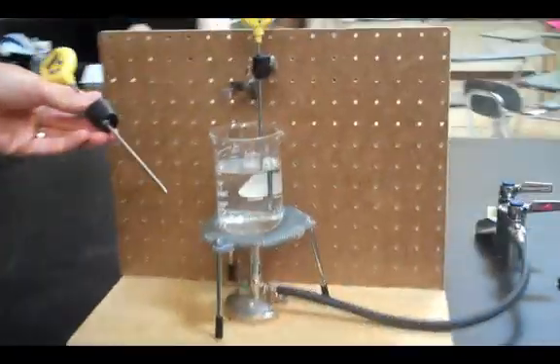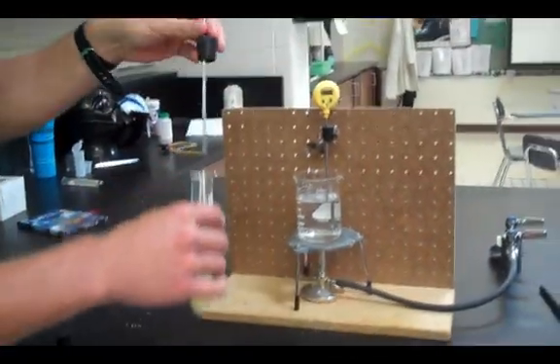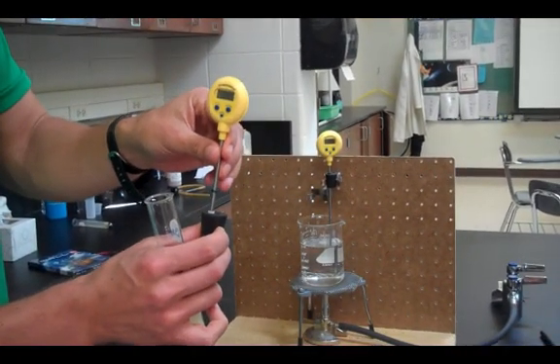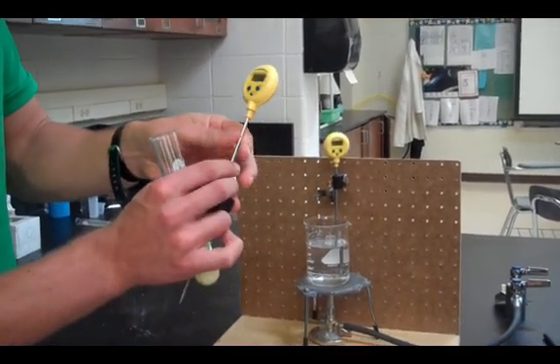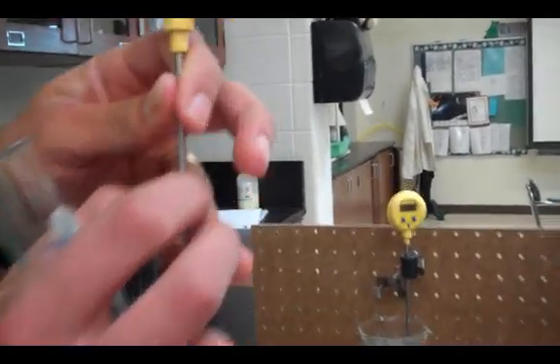So to do that, we're going to set up the experiment like this. I'm going to take my stopper that has two holes in it. One has a little white sleeve in there to hold the thermometer. I can adjust the height of the thermometer by moving this rubber ring up and down, and that will control how far the thermometer is in the test tube.